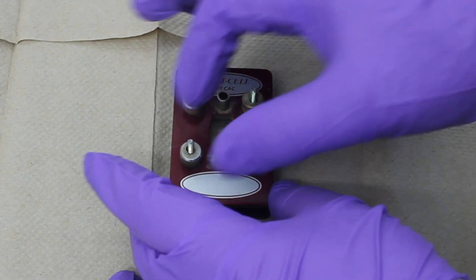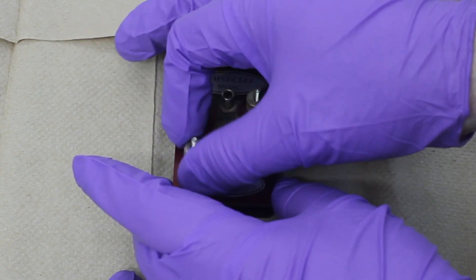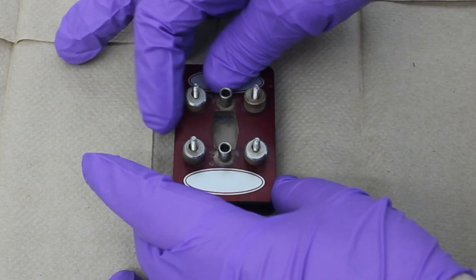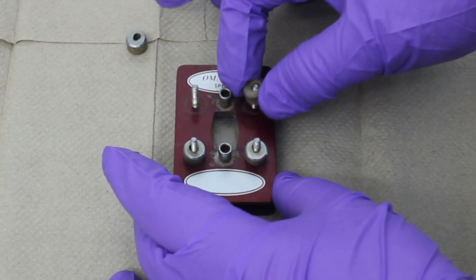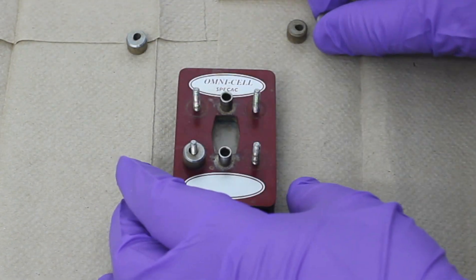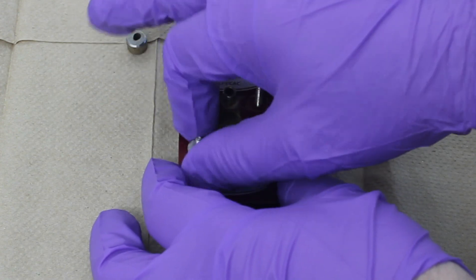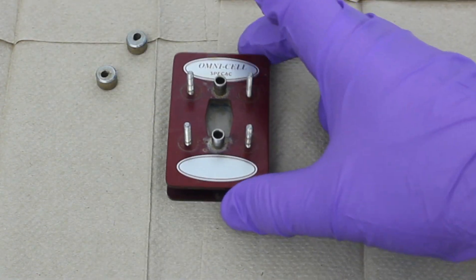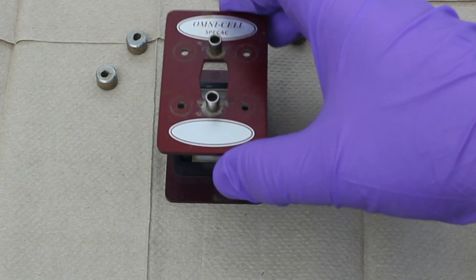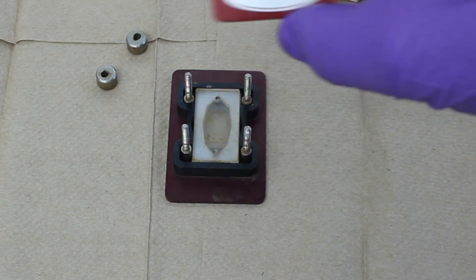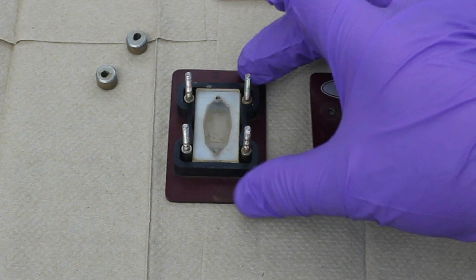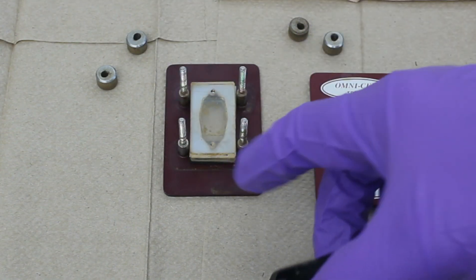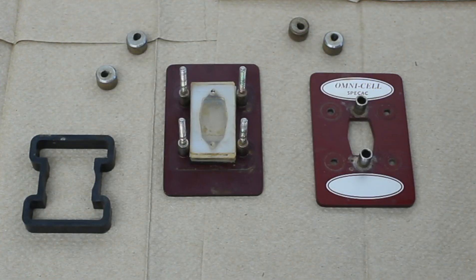Because it's really easy to forget to put in a spacer or something else. So I'm just unscrewing these connectors, the Luer screw. Now our cell will come apart. So this is one of the main body parts. This black mold is to hold the whole assembly in place.